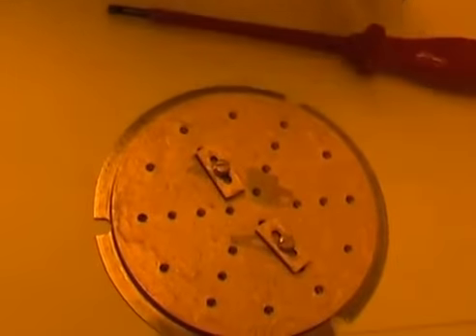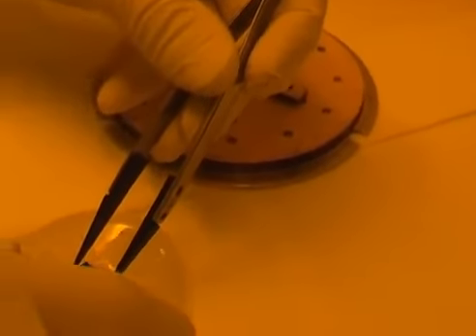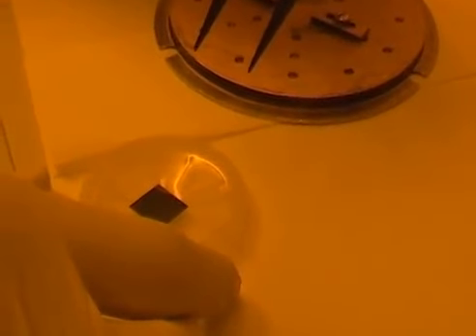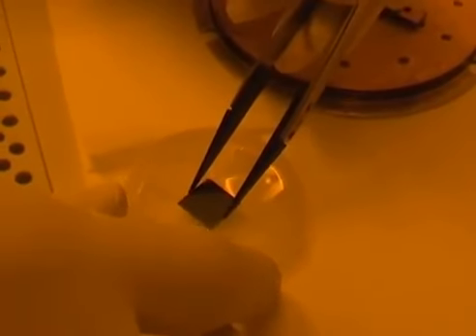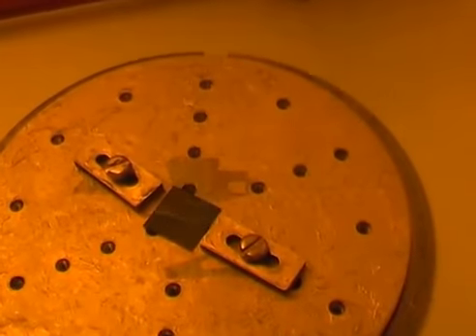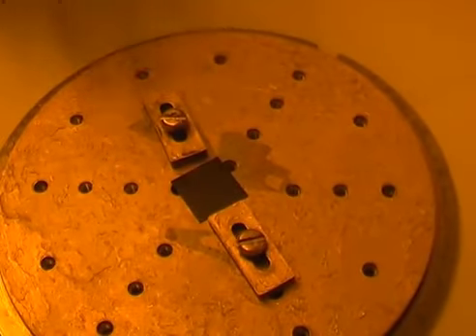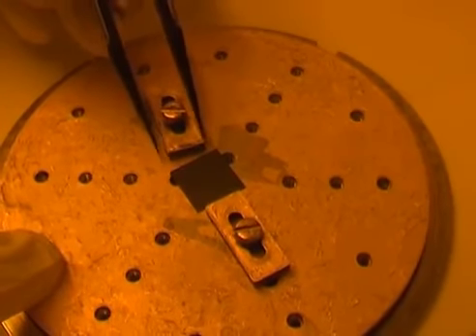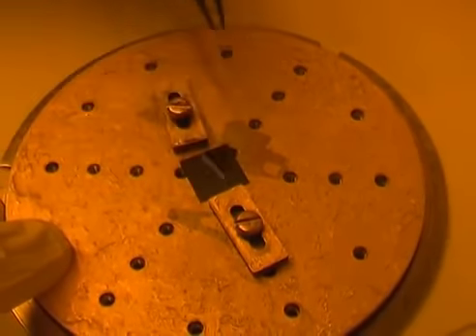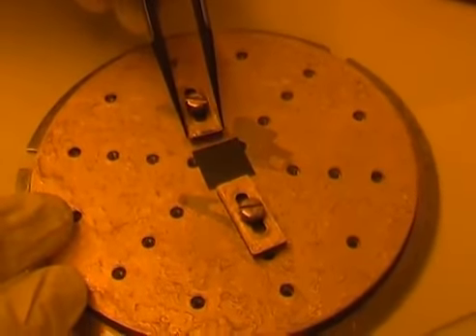during the deposition. Because, for example, if I'm trying to make liftoff of the deposited metal, if the sample is at an angle during the deposition, that can result in problems during the liftoff process. So once the clamps and the screw are loosely placed on the holder, then I place my sample in the center of the holder. I can deposit multiple samples at the same time if they all need the same kind of metal evaporation. In that case, I would just place more screws and clamps down.